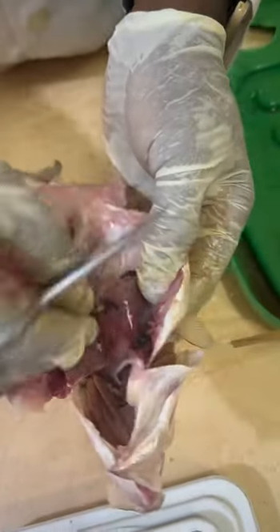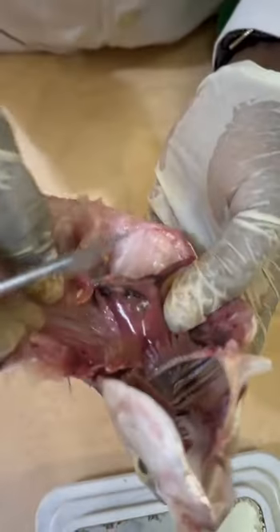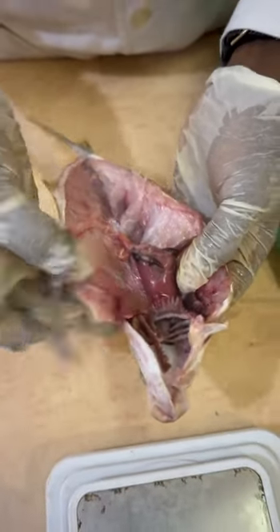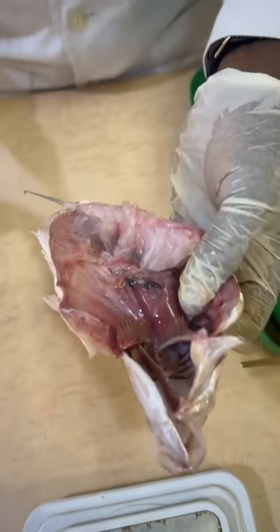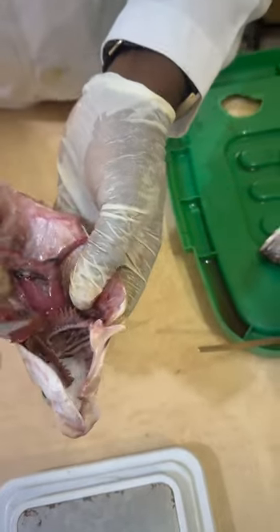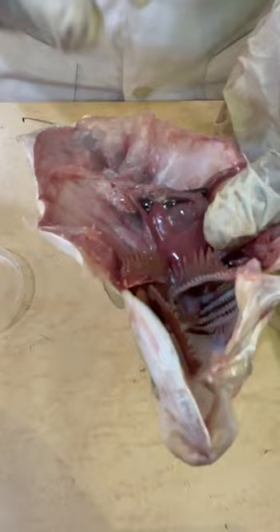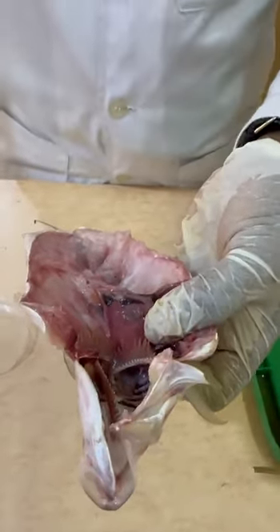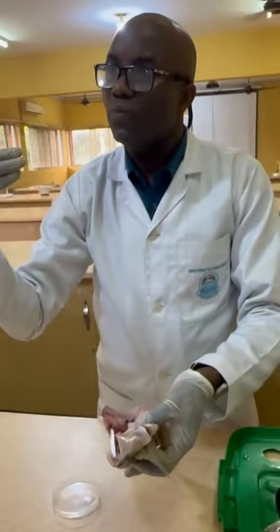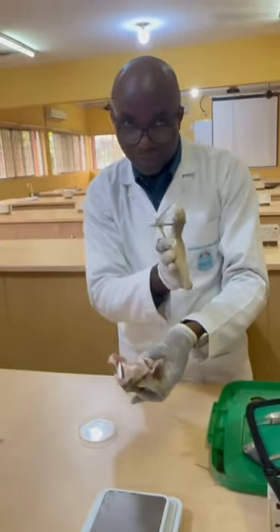Now, this particular one, the issue is that for the reproductive study, once you have opened up the fish very well, you will see the gonads are actually two, whether male or female. Now, looking at this, and the gonads, because of most times fishes have what's called cloaca. The cloaca is the external aperture through which about 3 different ducts coming from the fish, from different organ systems in the fish, they release to the external.